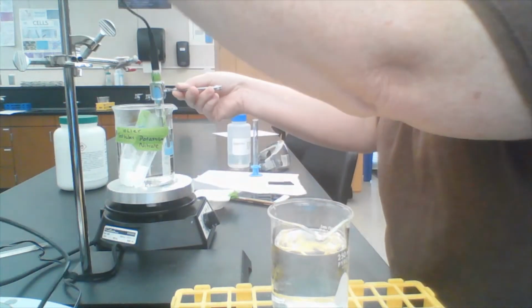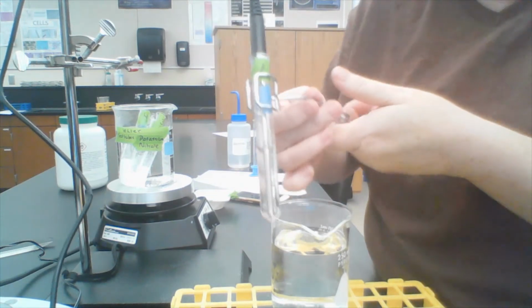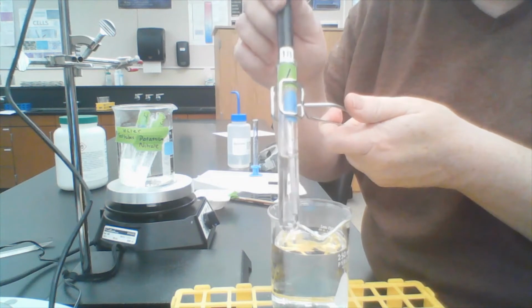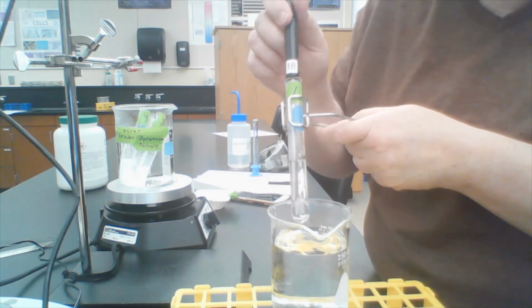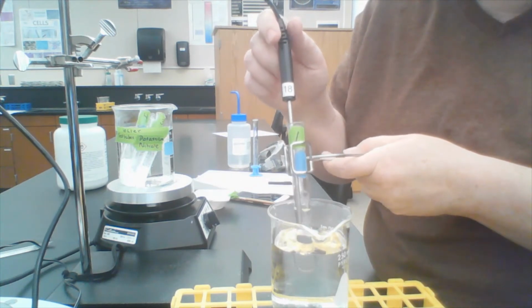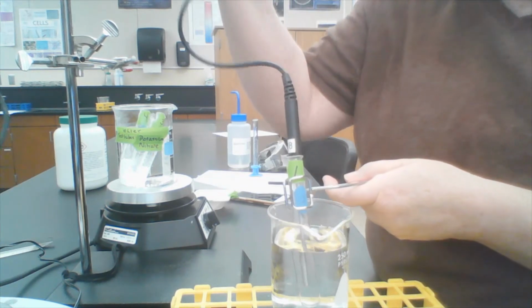Now I'm removing test tube 1 from the water bath, and I've got that temperature probe in it so I can record the exact temperature when the solid starts, and I know from experience that test tube 1 needs to be cooled off in water or we're going to wait forever for the crystals to start forming.